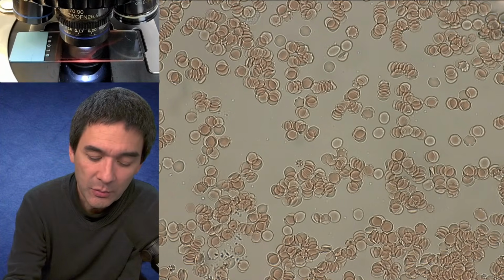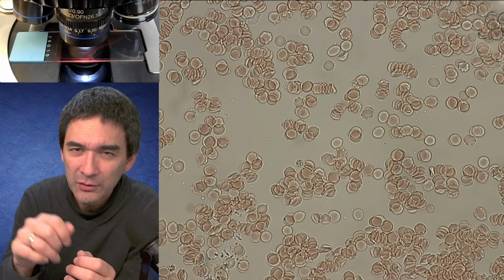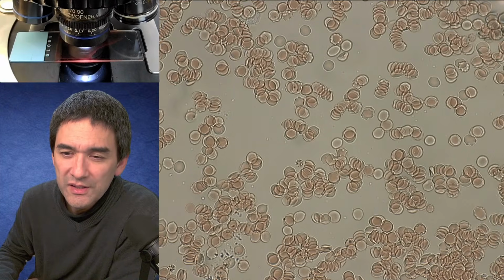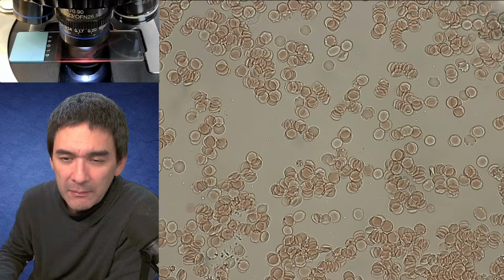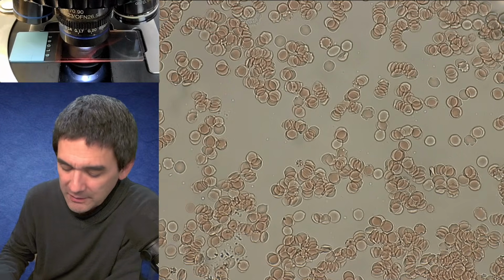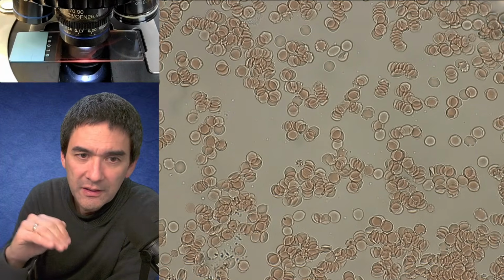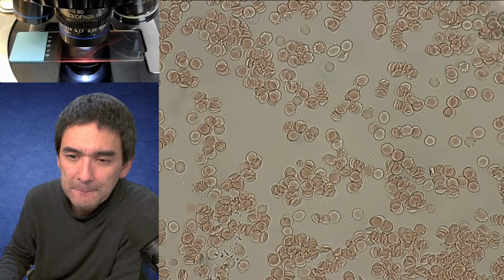Last year when I took along my other USB microscope, it was a little bit cumbersome because I had to have it connected with a mobile phone and so on. So it's for convenience reasons. How does it look if we use your phone as a backlight? I will try that. I have actually considered it myself, but maybe you're able to see the pixels, so maybe you need to add some kind of diffuser plate to make sure that the light is fairly even.